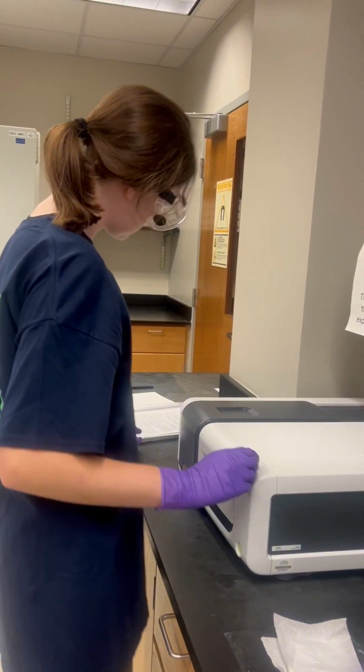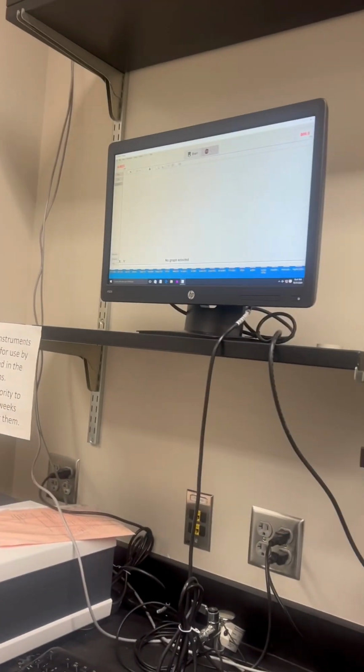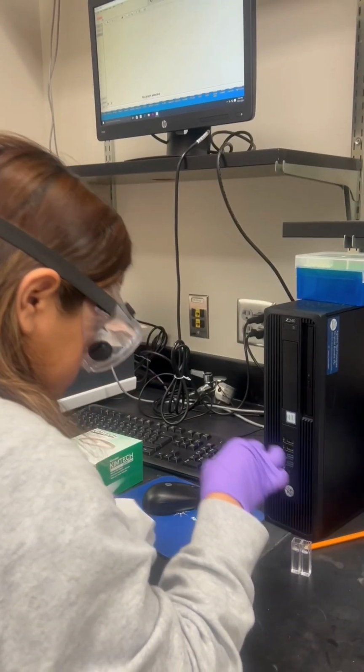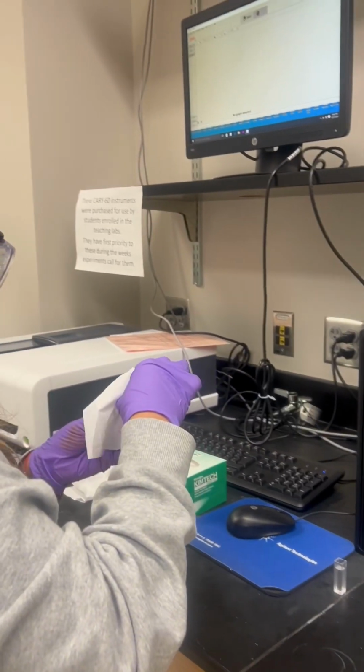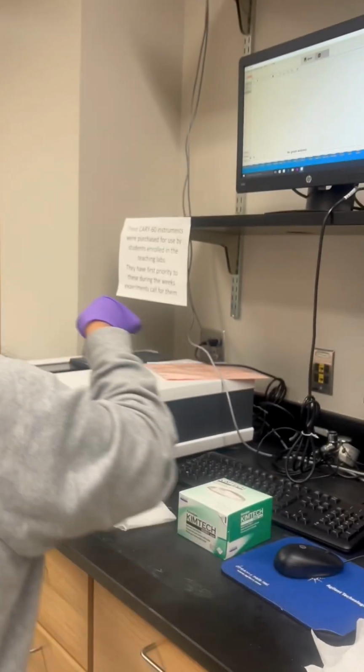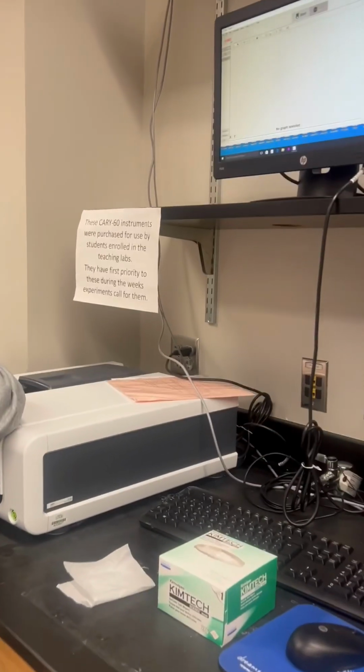One example of why you need to scan across all wavelengths is to accurately determine the absorption spectrum for your sample, because different substances absorb best at different wavelengths. Another example is so you can determine the identity of an unknown substance.